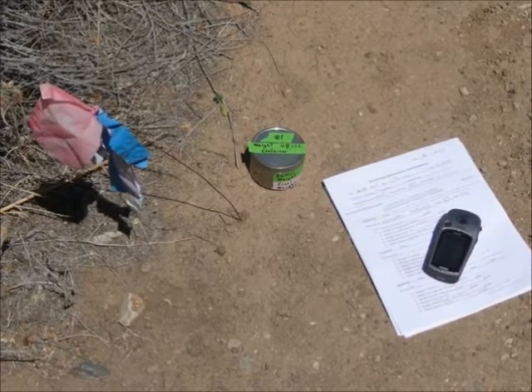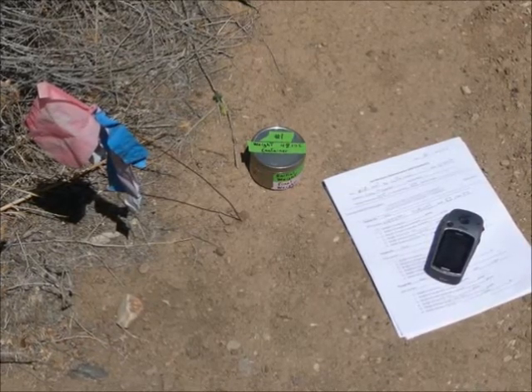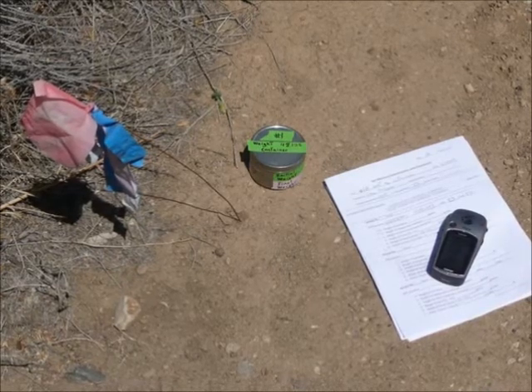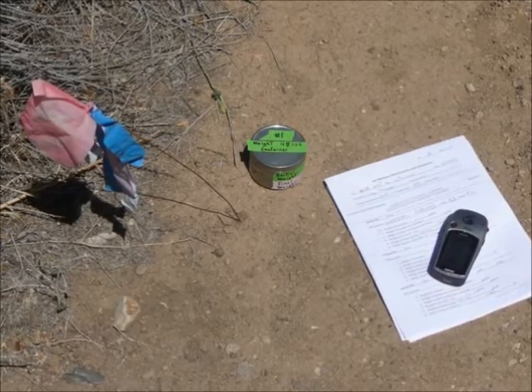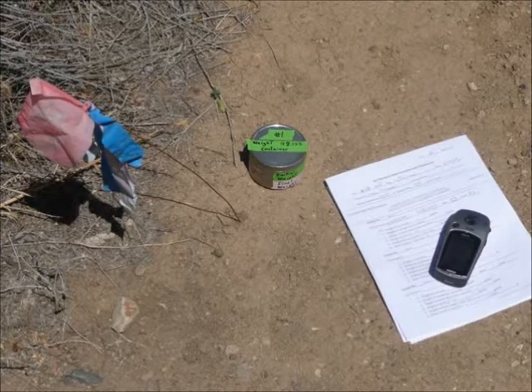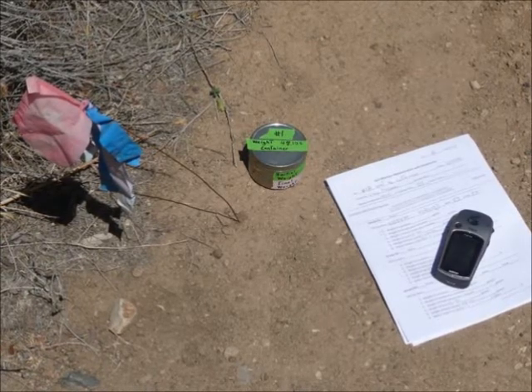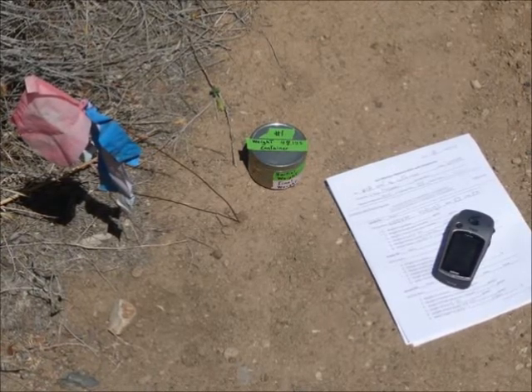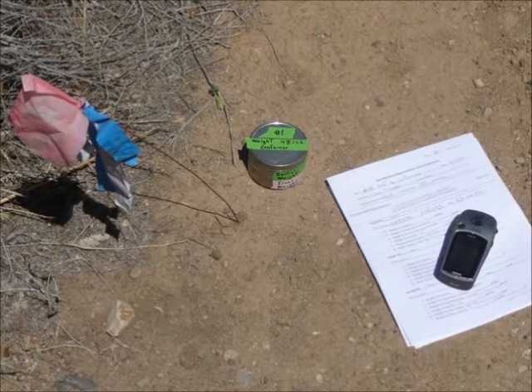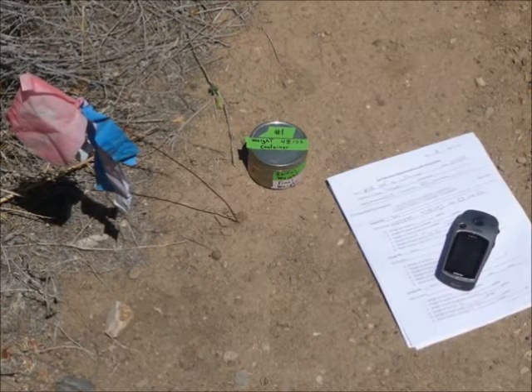Furthermore, the notes section of the datasheet should include all site-specific attributes such as vegetation, soil texture, slope, aspect, and generalized weather data such as temperature, cloud cover, and time of previous rainfall.